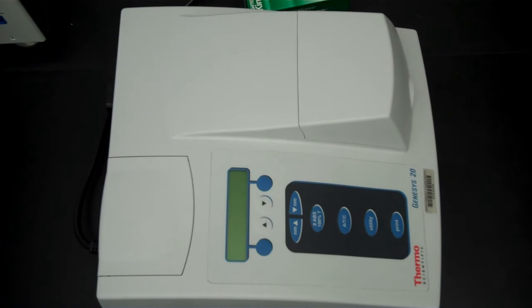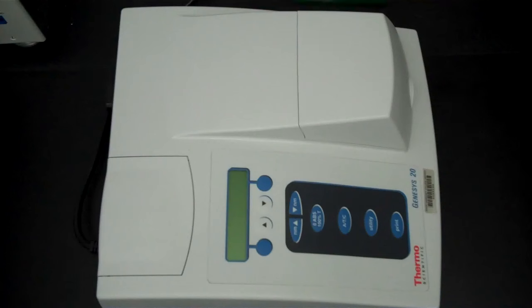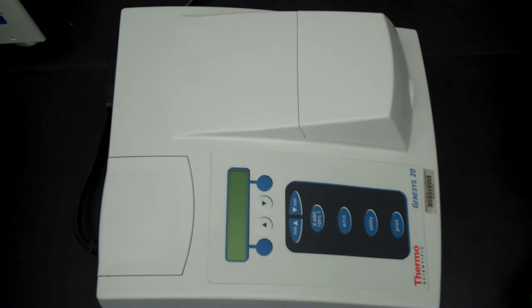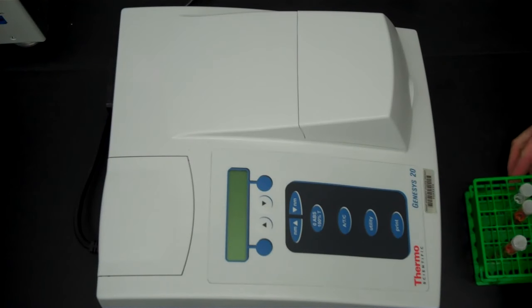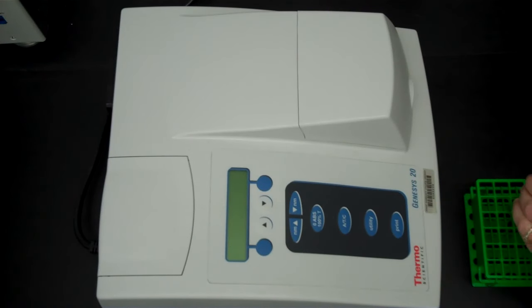In this video I'll be demonstrating how to use a spectrophotometer. A spectrophotometer is used to read the absorbance of various samples.